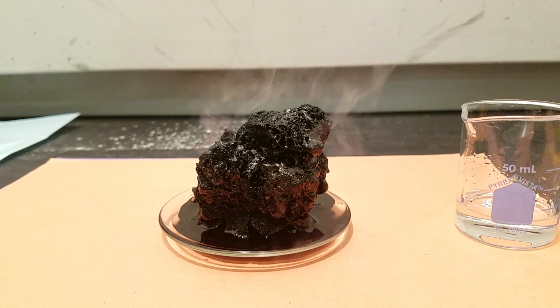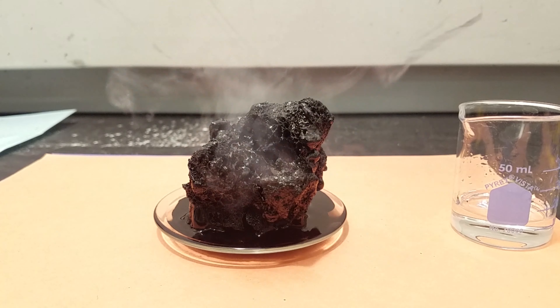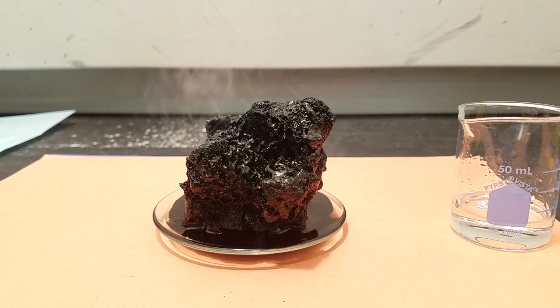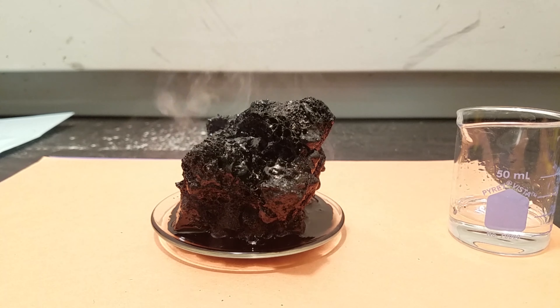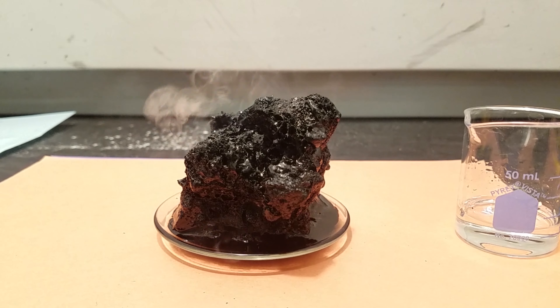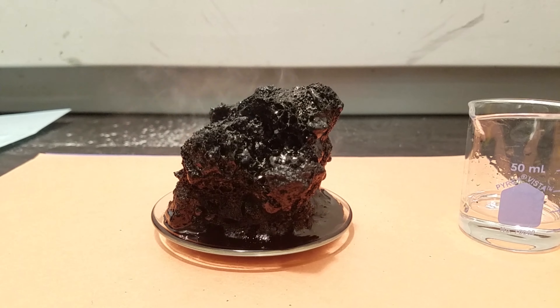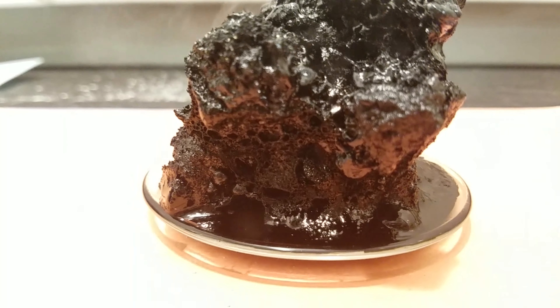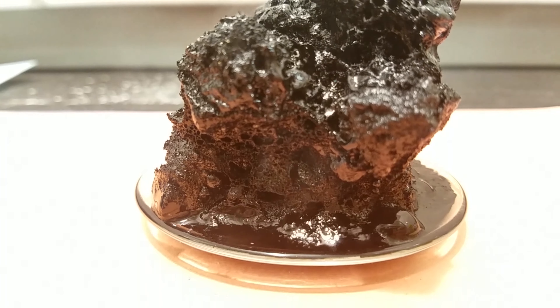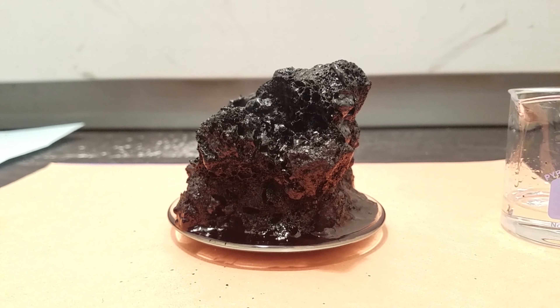So you want to keep it away from little babies, kids, teenagers, and communists. As you can see, we don't see any more presence of sugar cubes. Now it looks like a very scary looking alien creature that's bubbling and vaporizing.